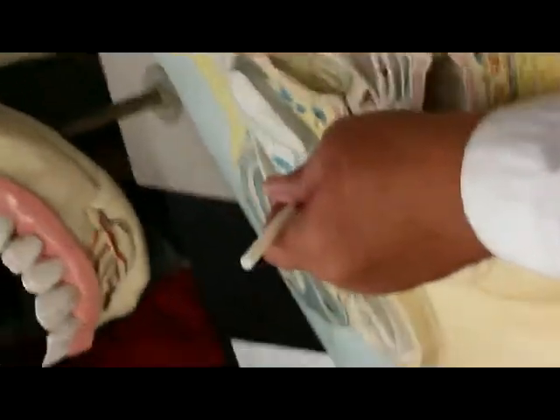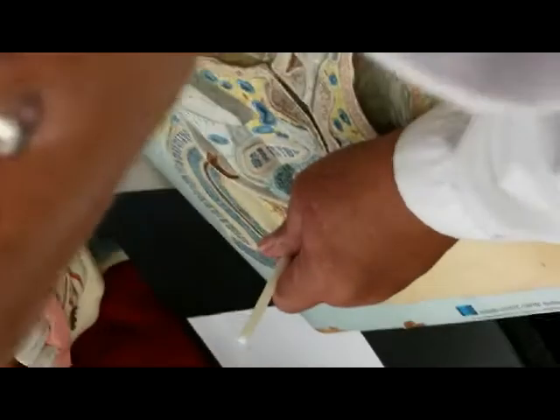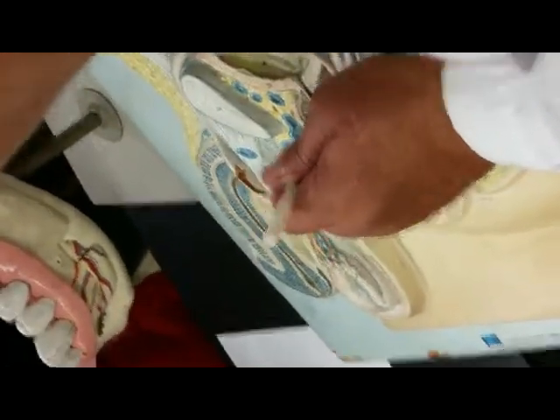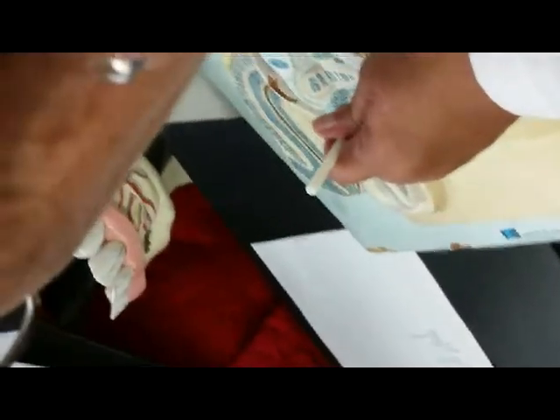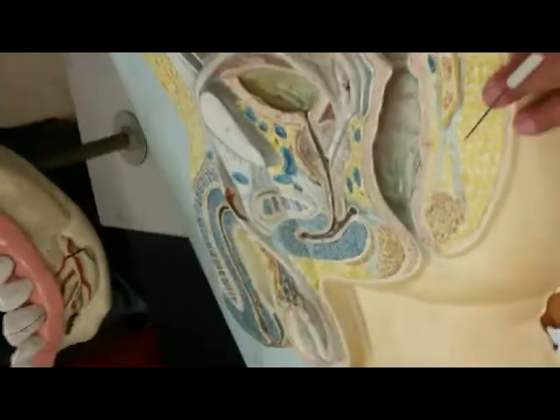So if I pin there, I'm looking for what? The prostatic urethra. If I pin this, I'm looking for what? Membranous urethra, because here is the urogenital diaphragm. And if I pin down there, I'm looking for what? Penile or the spongy urethra. 3 parts. When it passes through the prostate gland, it becomes the prostatic urethra. Through here is the membranous. And any place through the penis, it becomes the spongy or the penile urethra.